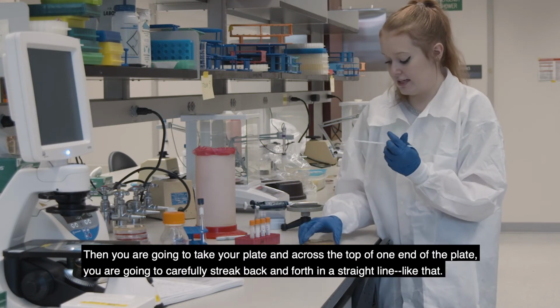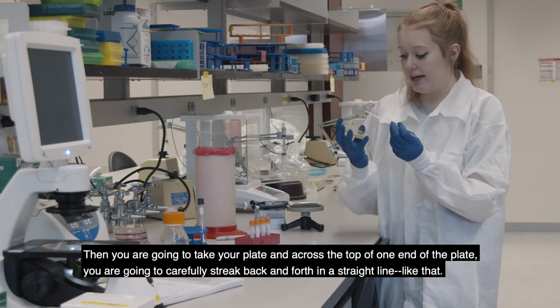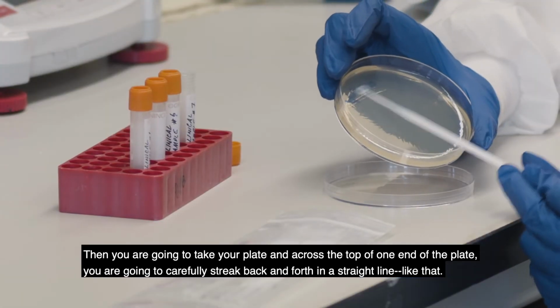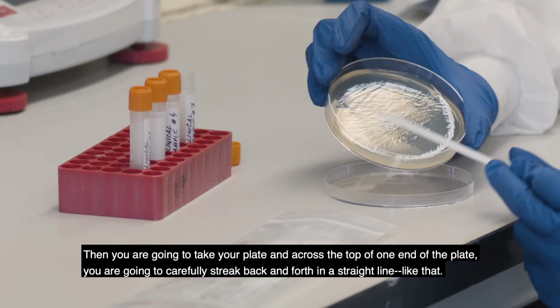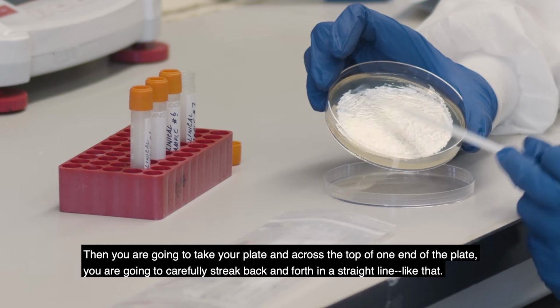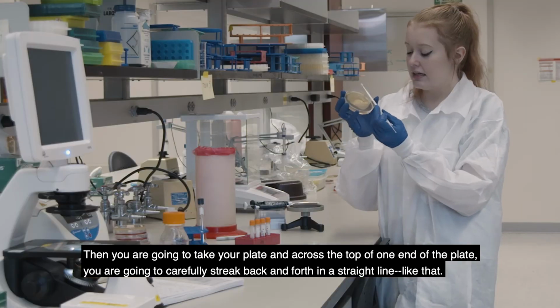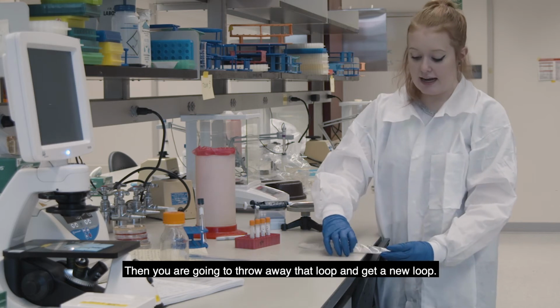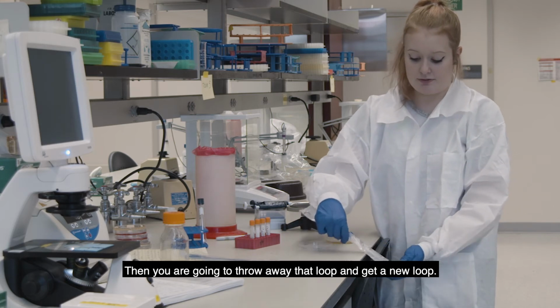Then you're going to take your plate and across the top of one end of the plate, carefully streak back and forth in a straight line like that. Then you're going to throw away that loop and get a new loop.